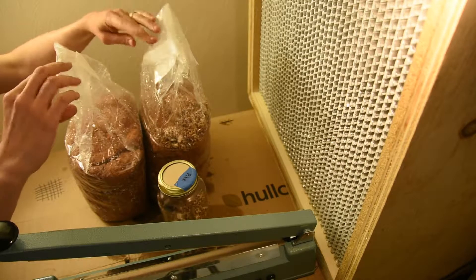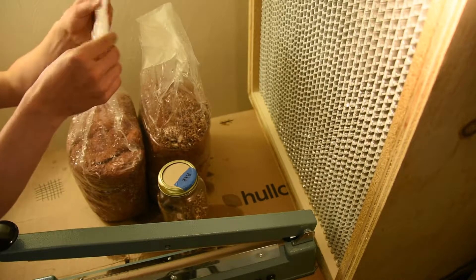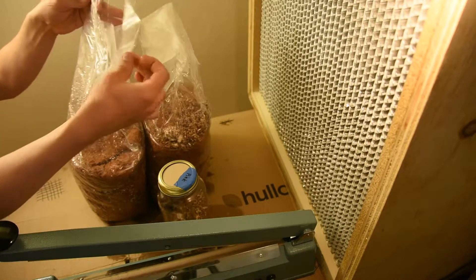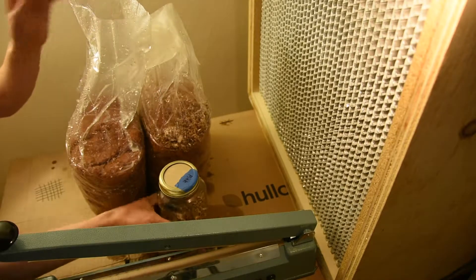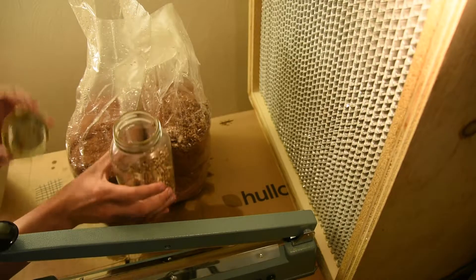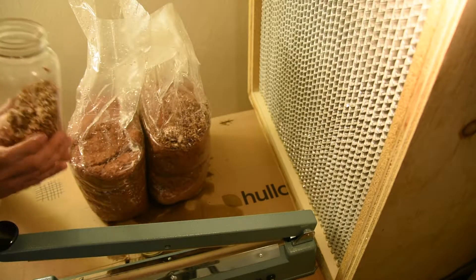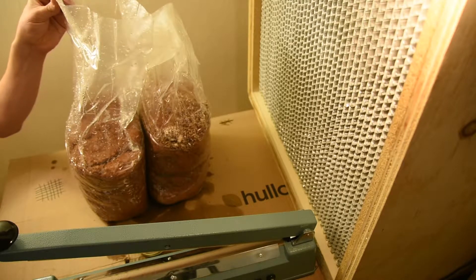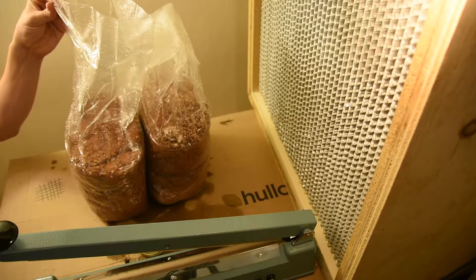I'm going to loosely fold this back up with the folding it had during the pressure cooking process, then move on to the second one. Same thing — I'm going to do the half turn rolling of my wrist, but this time I might tip a little bit more because there's not as much grain in.